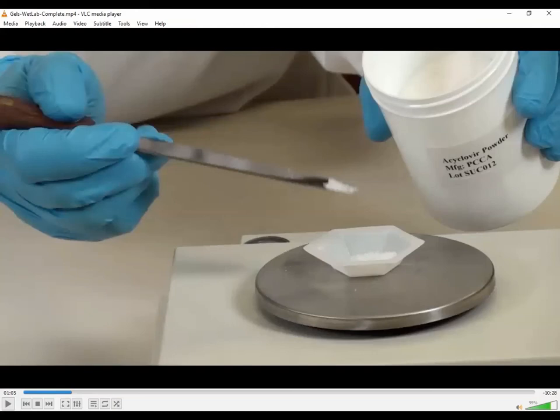So get 2 scoops, go back to your mortar, grind it or triturate it really fine, and then weigh out your final amount. You do want to make sure that you're using finely triturated acyclovir powder. Trust me, otherwise it will not dissolve on you. You want to grind it up first. So you're going to grind it up and then weigh out the amount of acyclovir powder that you want.